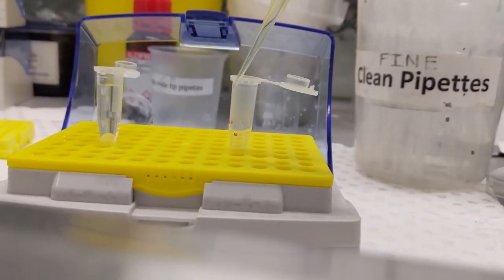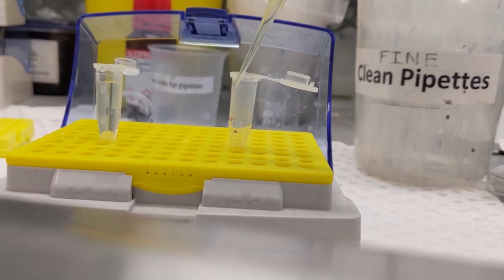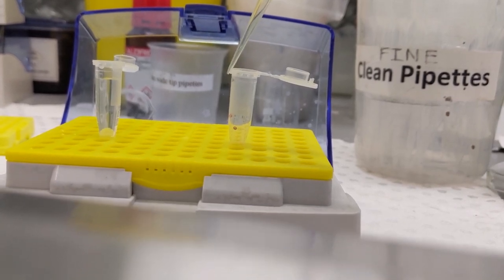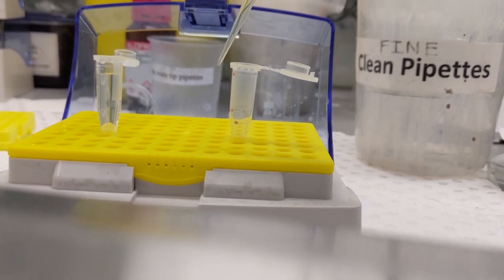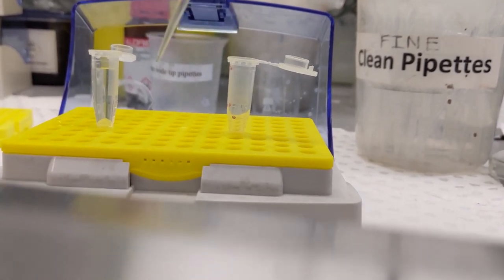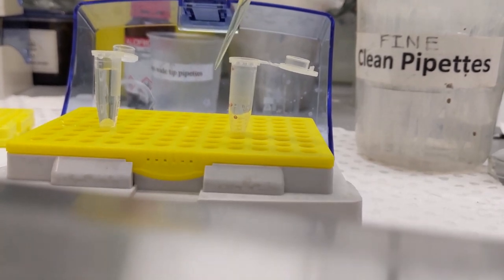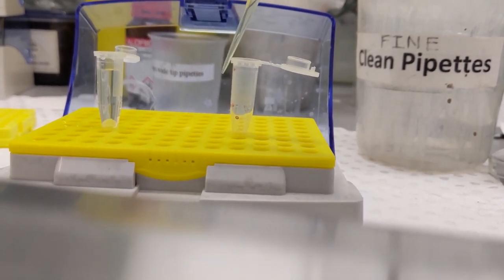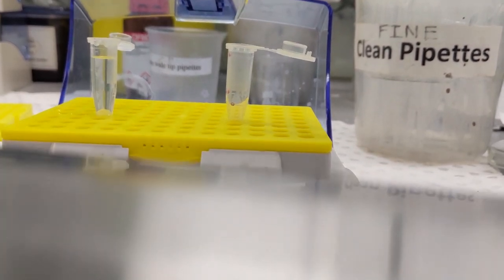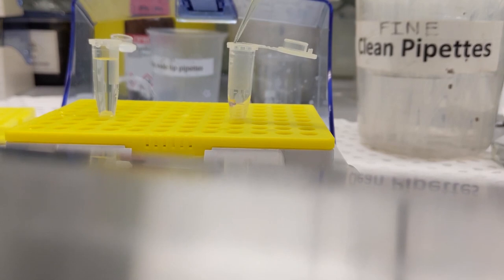Here I have 50 microliters of the nanoparticles in the citrate solution. We're going to dilute this down so that we get a nice thin layer of the nanoparticles on the TEM grid when we come to drop cast it. What we're going to do is take 50 microliters of the milli-Q water and add that to the nanoparticle solution.